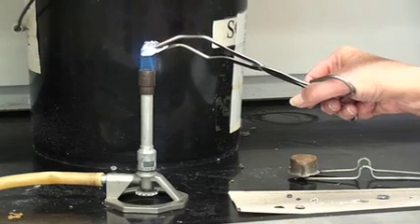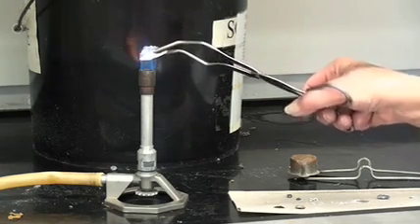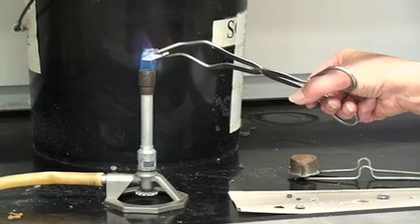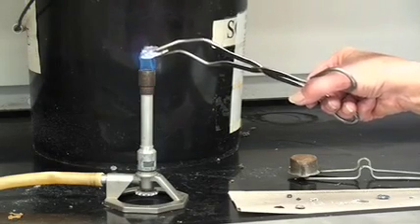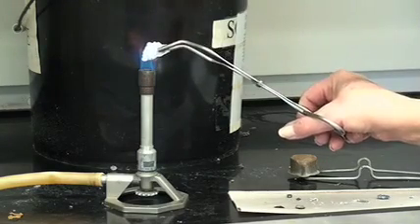And we're being very patient. And it continues to be shiny.